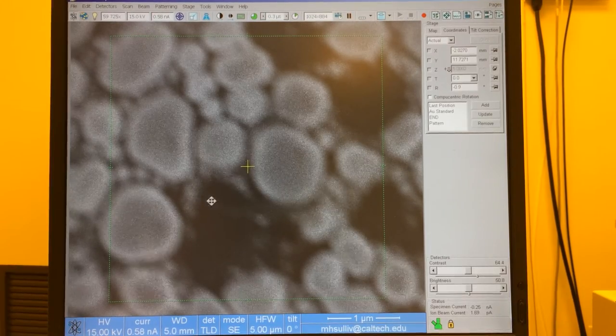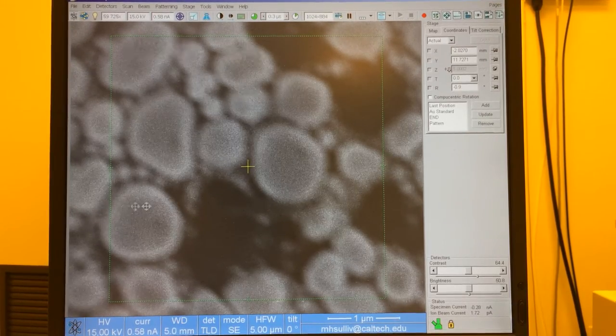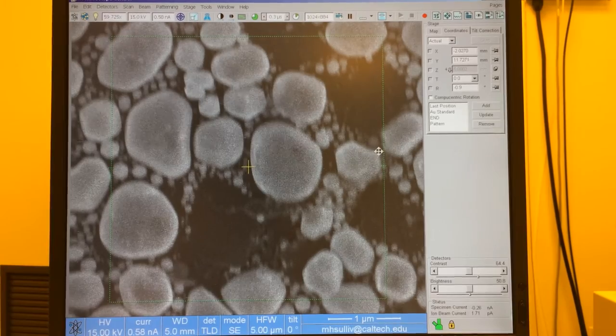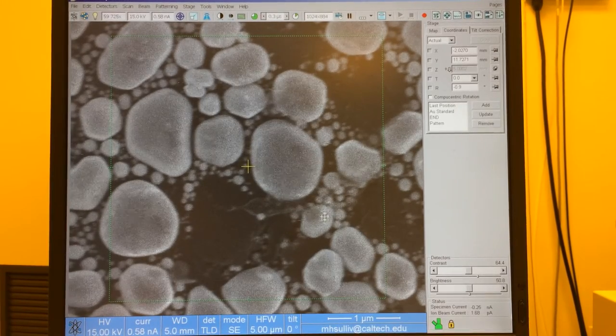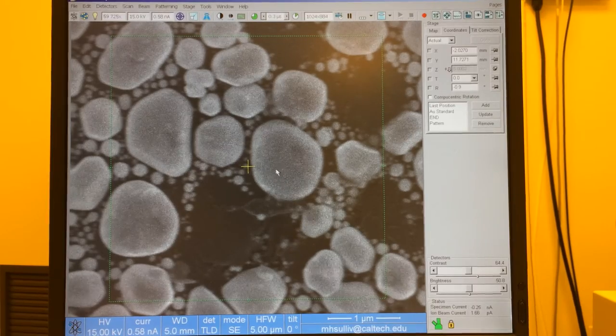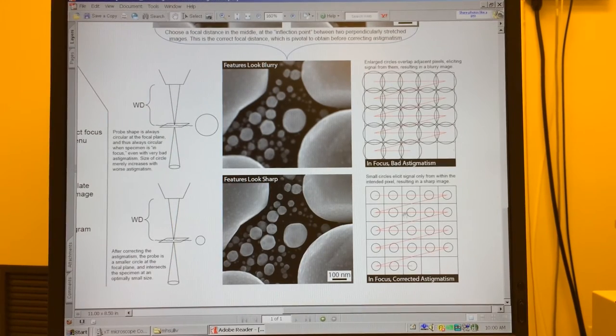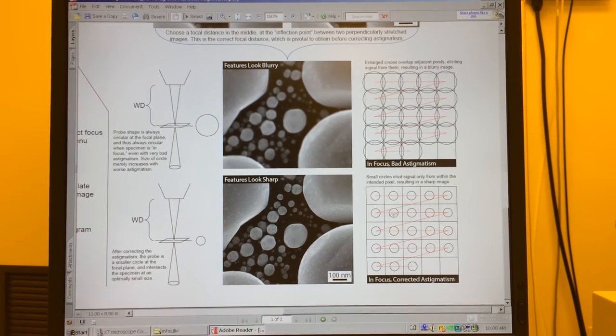So when we now go shift right click and we try to fix the astigmatism, left and right for X, up and down for Y, and we can see I'm getting back to a reasonably sharp image. What we're doing is by adjusting the astigmatism, we're pushing the shape of the beam from an ellipse into a circle above and below the focal plane, and that makes us have a smaller circle at the focal plane. So now if we step that small circle on each pixel, we're only pulling information from that pixel, and we're going to get a nice sharp image.